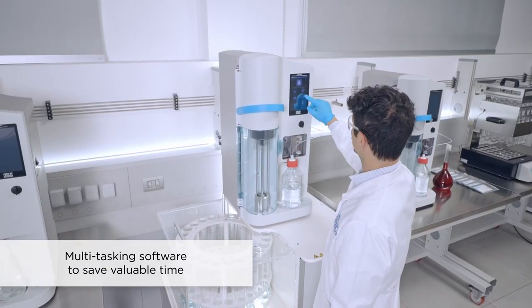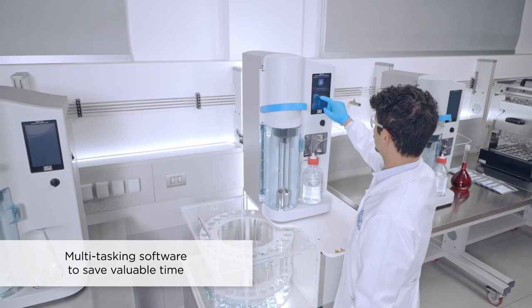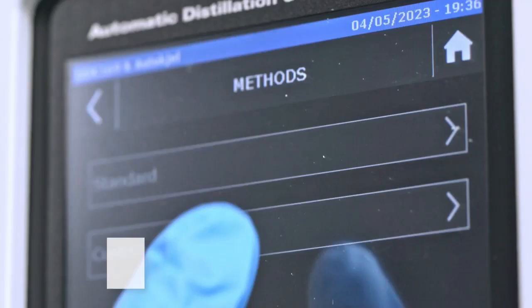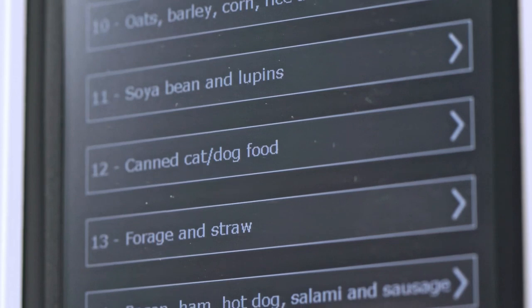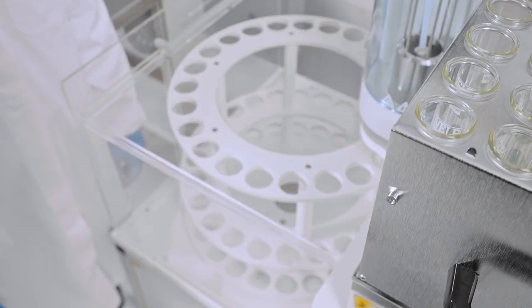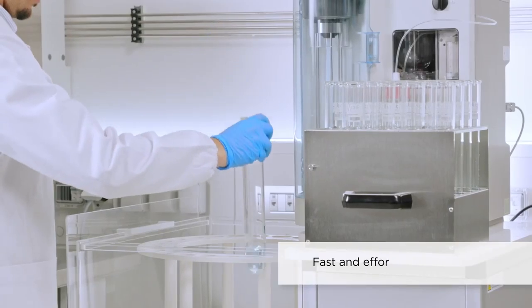The multitasking software provides full control of the distillation unit and the autosampler to set up a series of analyses, saving valuable time. Choose from the rich library of pre-installed methods or create a new one following the guided procedure. When combined with the Autosampler, it requires the lowest operator time for Kjeldahl analysis.